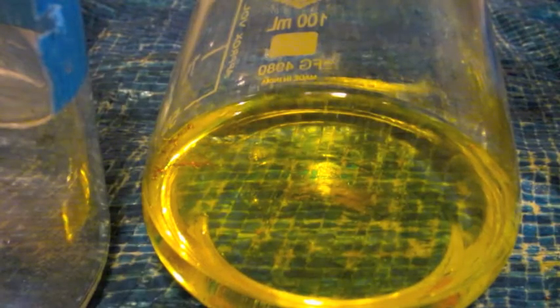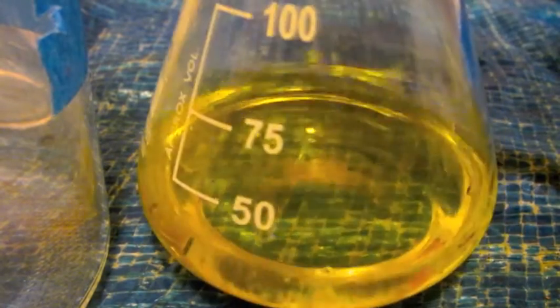Okay, I closed the garage door so you can see this better, and there's just a little tiny bit of gold left. It's almost all dissolved. And I'm going to skip to the end. This entire process took about 5 minutes. And you can see the deep yellow color of the solution is because of dissolved gold. Okay, now all of the gold has been reacted, not a trace remains, and this is now a solution of chloroauric acid, and of course some nitric acid and hydrochloric acid that's unreacted.